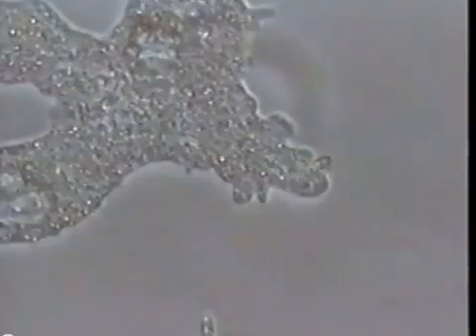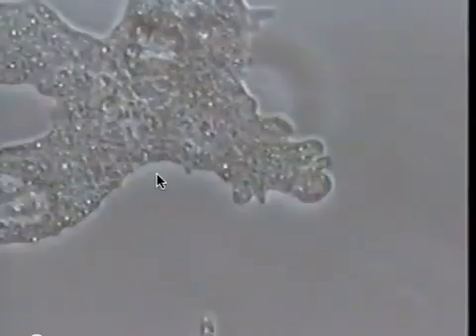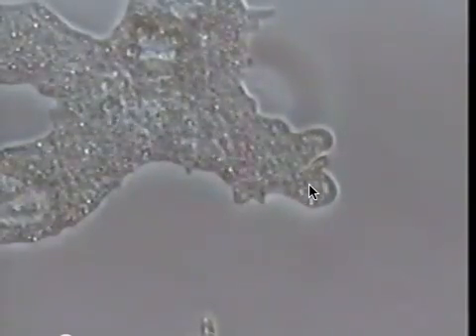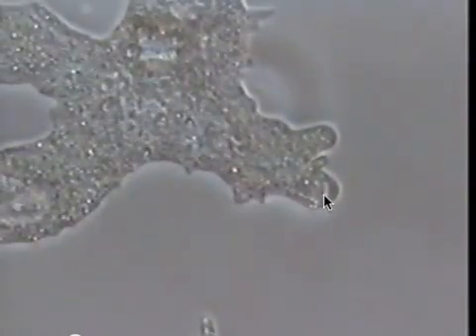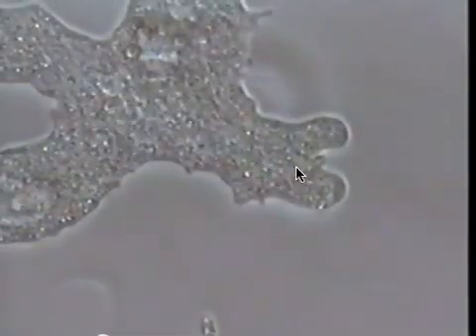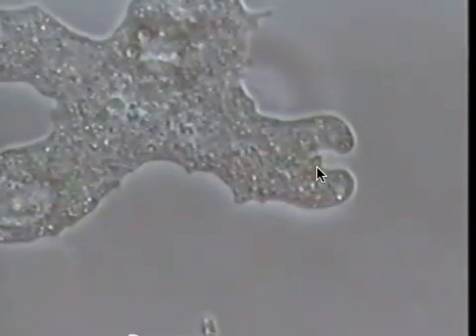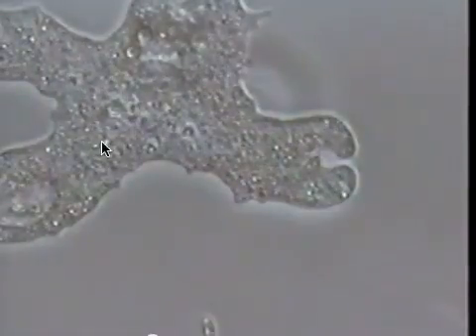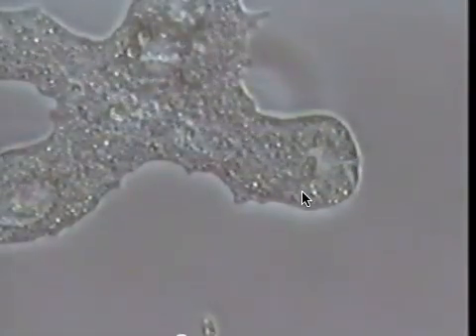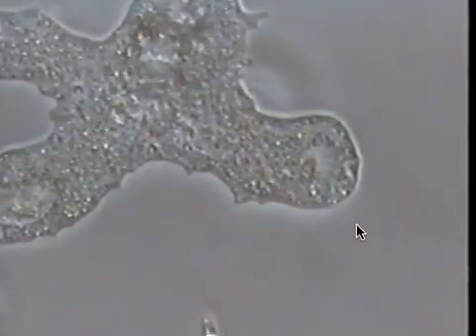The first protist you're going to be looking at is an amoeba. An amoeba is an irregular shaped protist with structures called pseudopods. This one right here is stretching out its pseudopods to engulf that food particle right there. You can see the cytoplasm streaming inside — it streams out the cytoplasm as they slowly move their pseudopods.